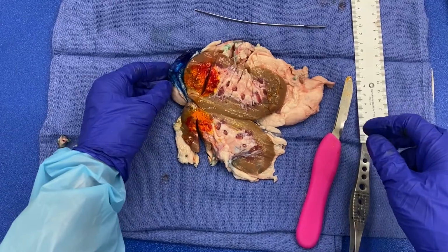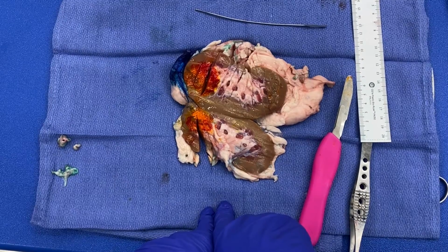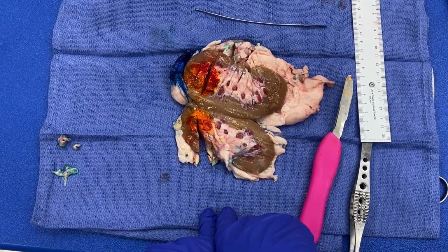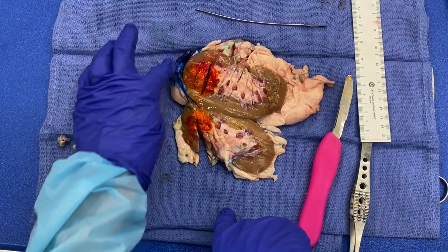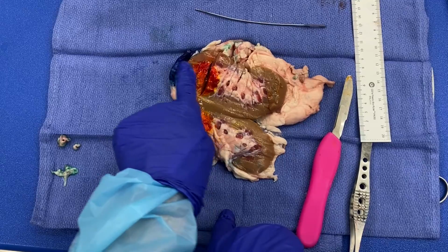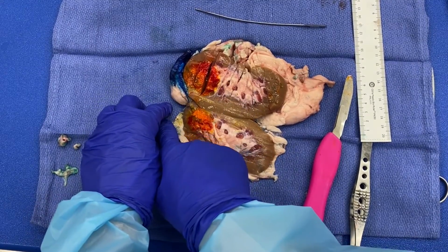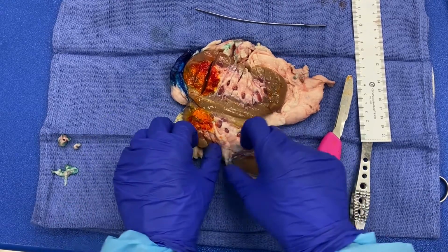Okay, remember again that you would make sure to document if the tumor is directly involving your adrenal gland, or if when you section through the adrenal gland, there's a discontinuous tumor, as this changes the staging from a T4 if it's a continuous spread, meaning say right here was my adrenal gland. If the tumor was spreading directly into it, that would make it a T4. However, if there was kidney parenchyma, let's say over here, if you had normal kidney parenchyma and then your adrenal gland, and then there was a lesion in the adrenal gland, that's discontinuous, and that would be considered a M1 metastasis.